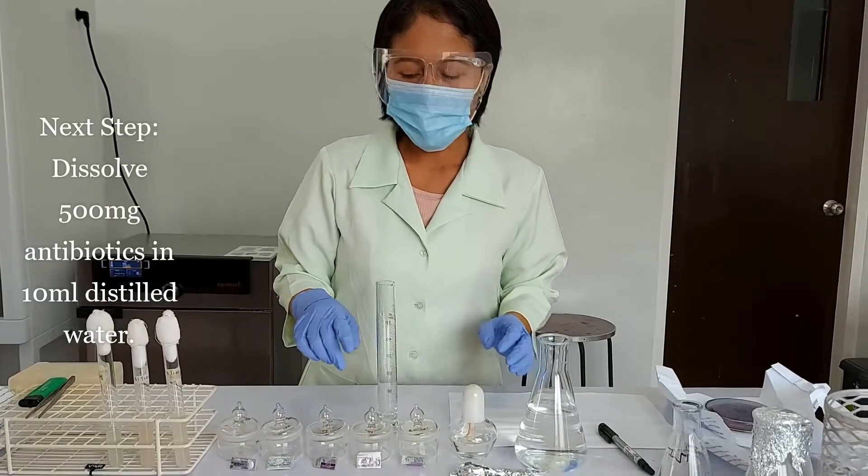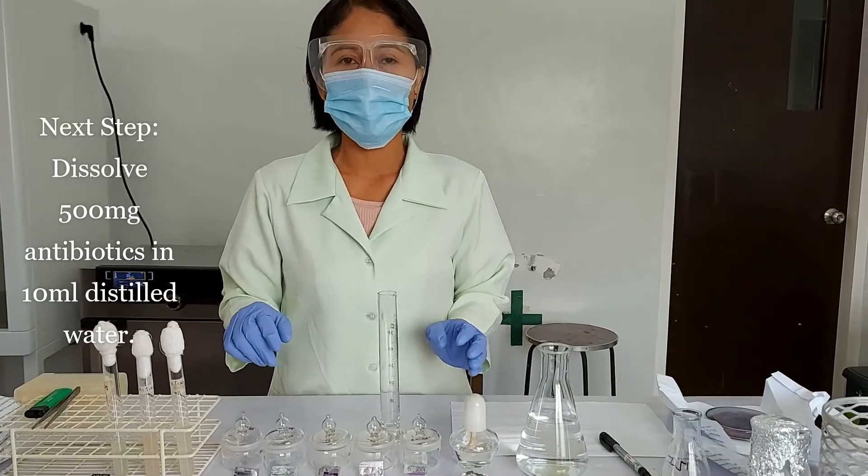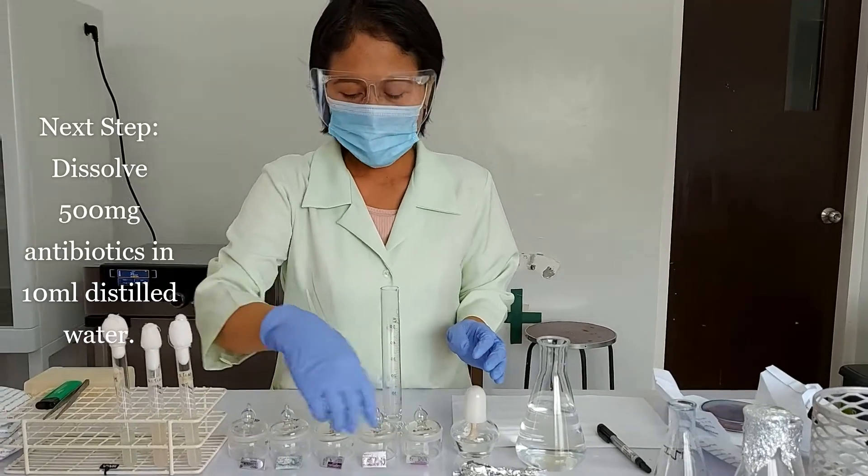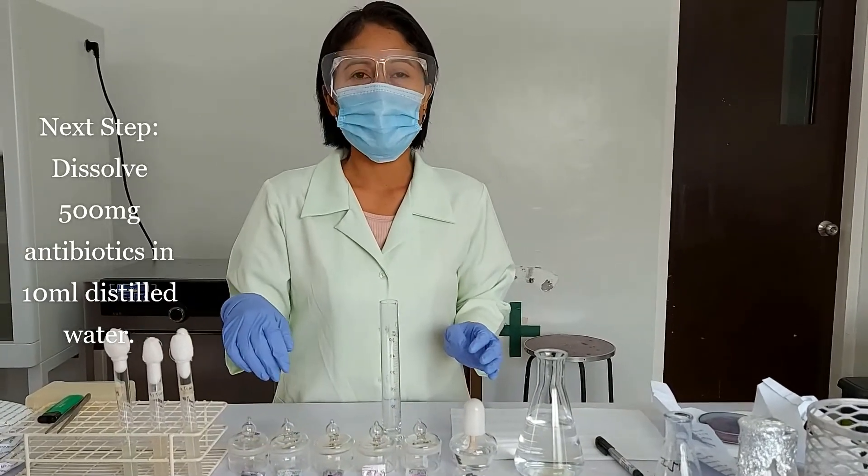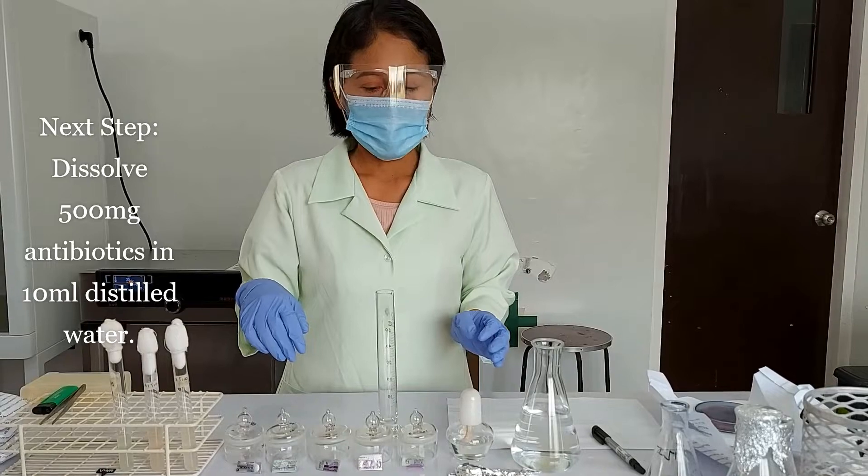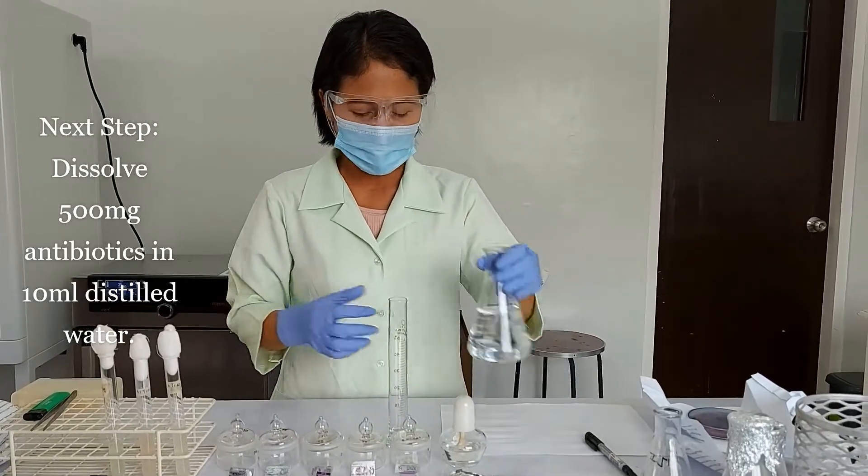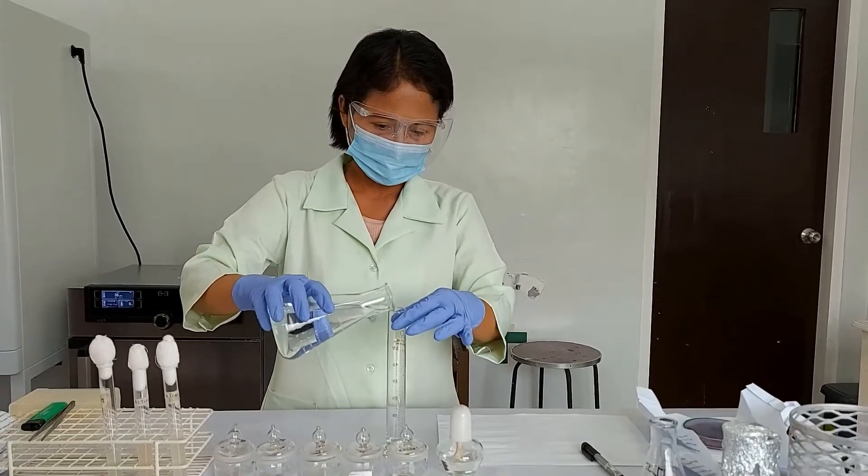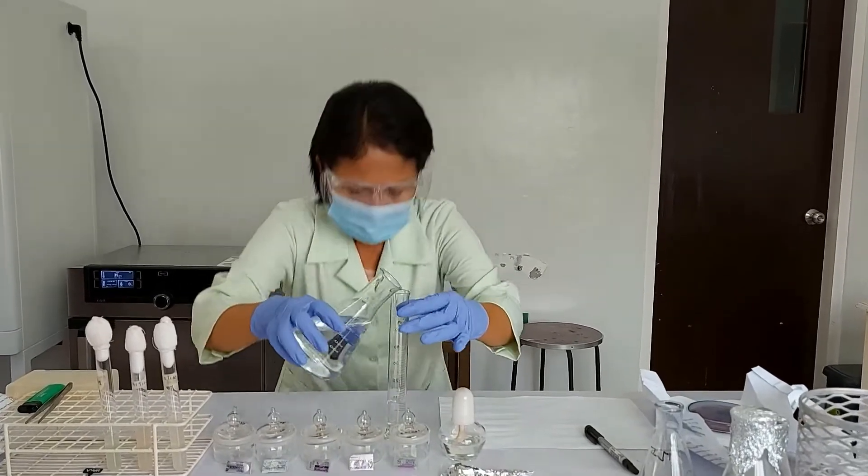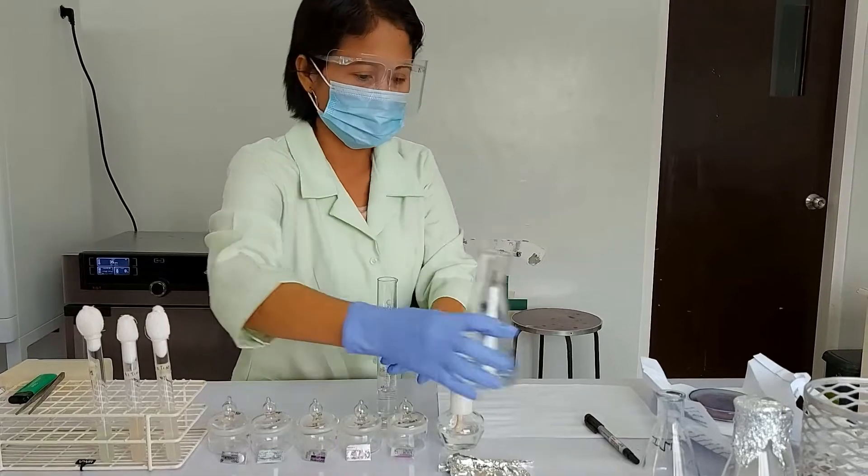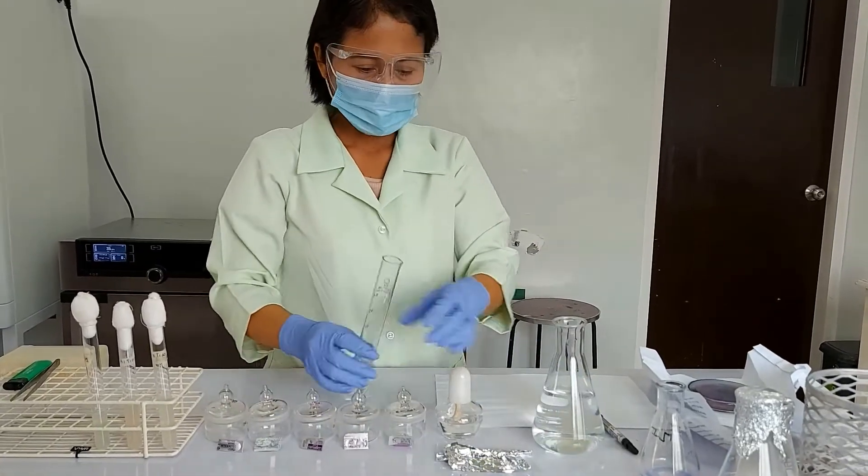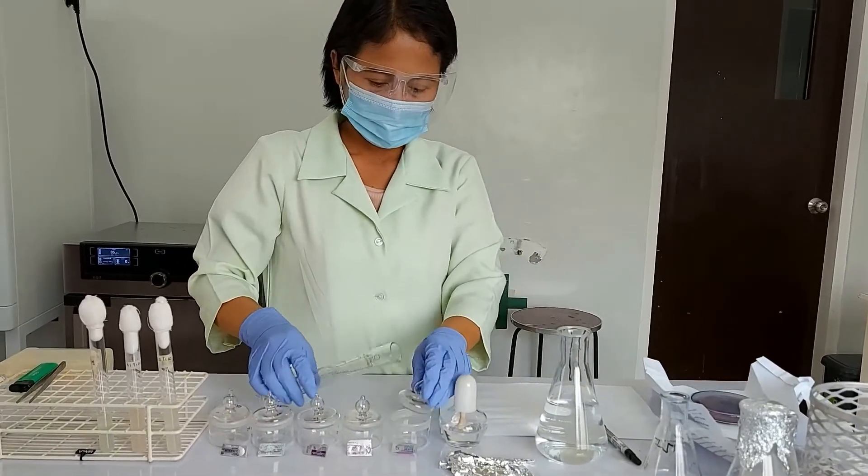We are going to dissolve our antibiotic. These antibiotics are all 500 mg, and I'm going to dissolve them, according to standard, in 10 ml distilled water. So here we are, we are going to dissolve them all together.